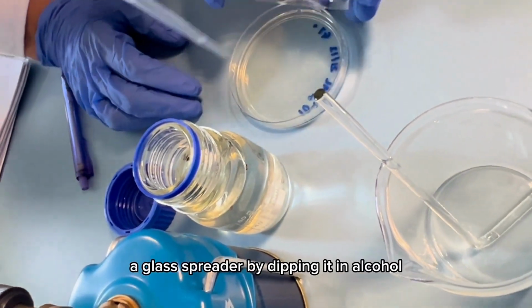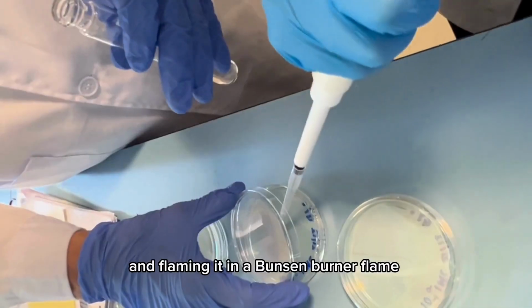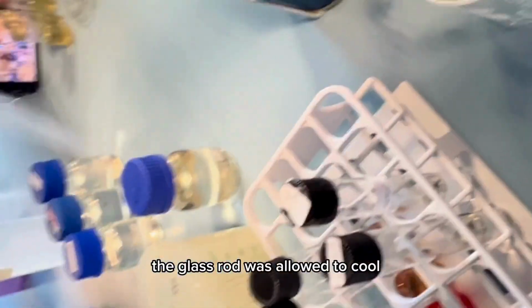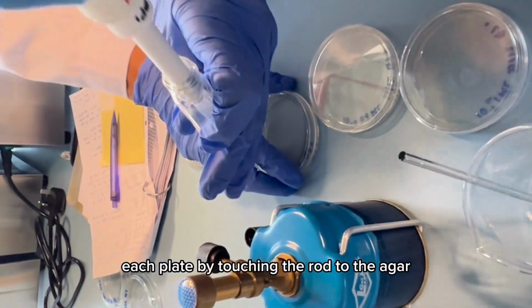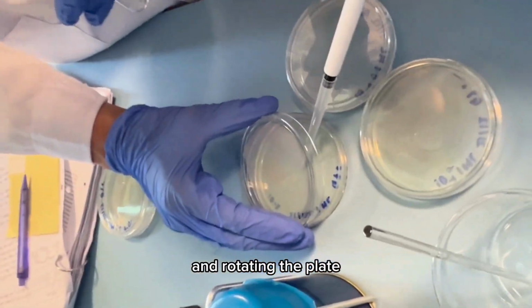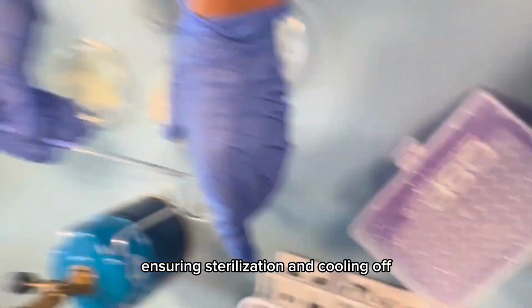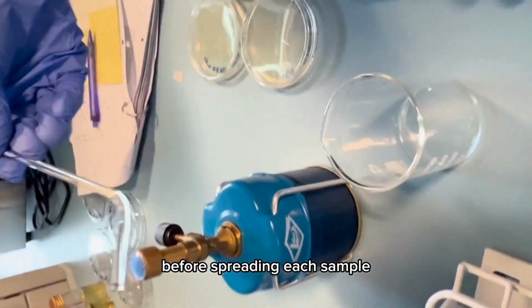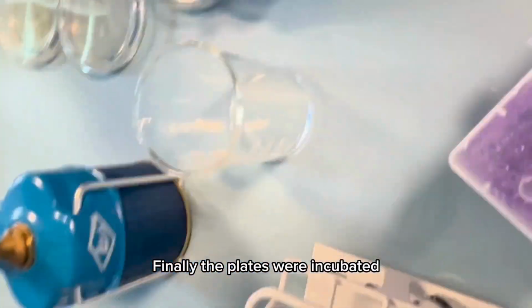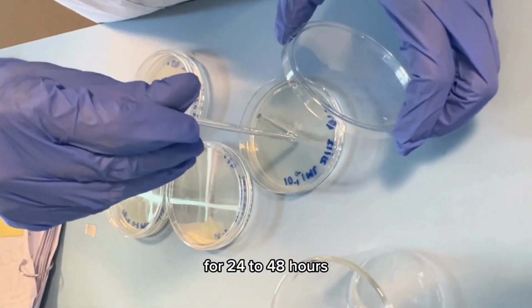After sterilizing a glass spreader by dipping it in alcohol and flaming it in a Bunsen burner flame, the glass rod was allowed to cool. The sample was then spread over the surface of each plate by touching the rod to the agar and rotating the plate. This spreading procedure was repeated for each plate, ensuring sterilization and cooling of the glass rod before spreading each sample. Finally, the plates were incubated inverted at 30 degrees Celsius for 24 to 48 hours.